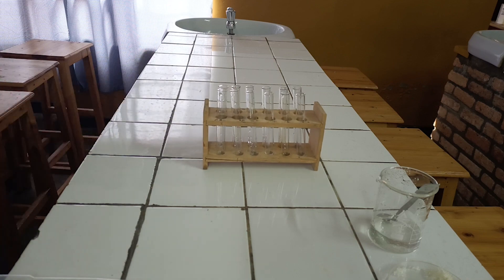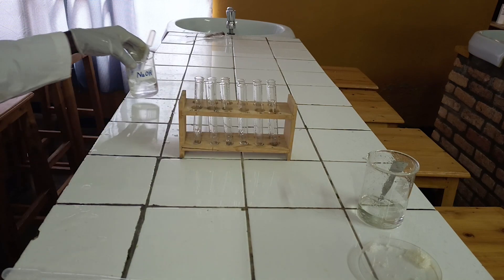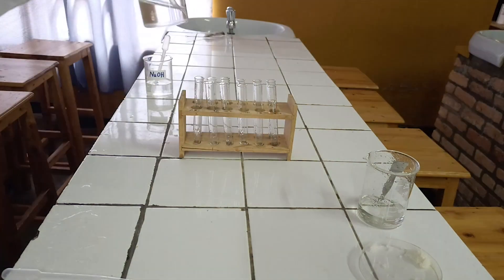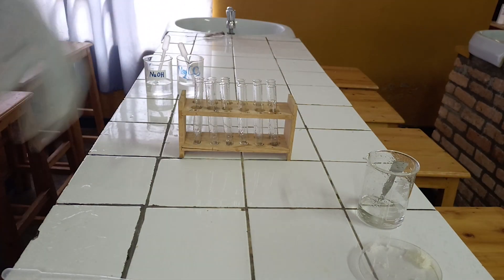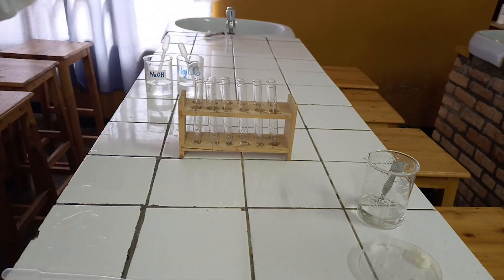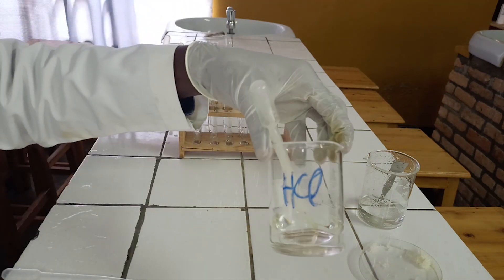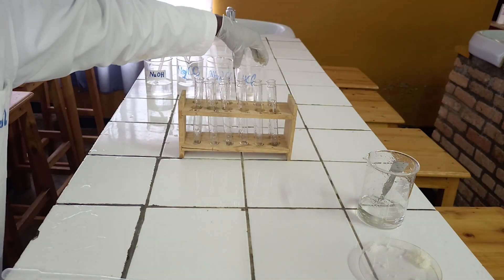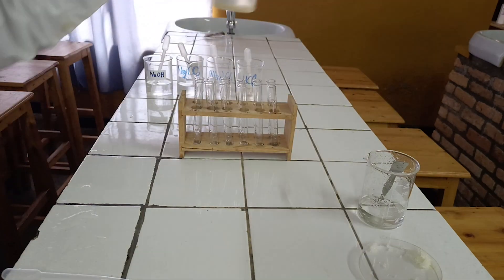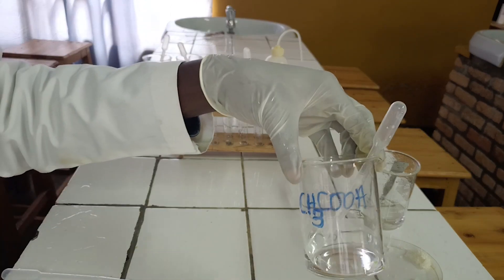Chemicals required: 1. Sodium hydroxide solution. 2. Sodium carbonate solution. 3. Ammonium oxalate solution. 4. Diluted hydrochloric acid. 5. Diluted ammonia. 6. Acetic acid solution.